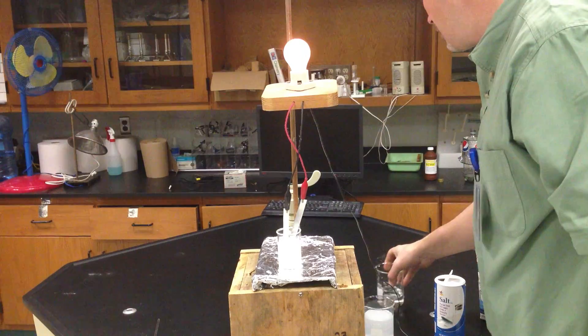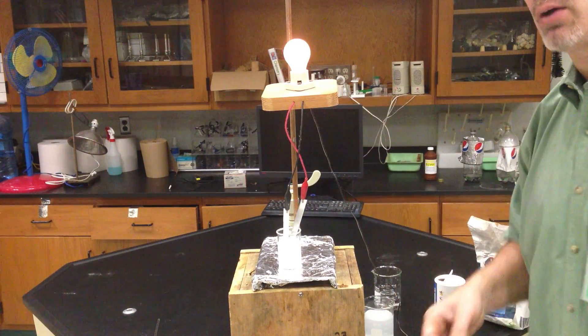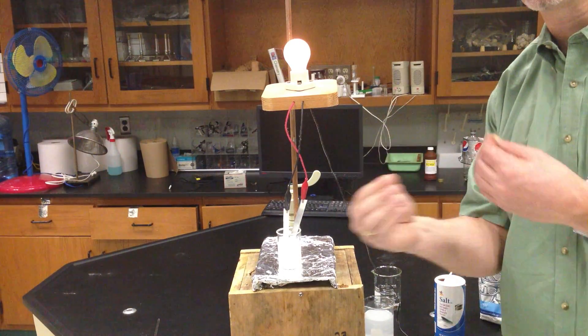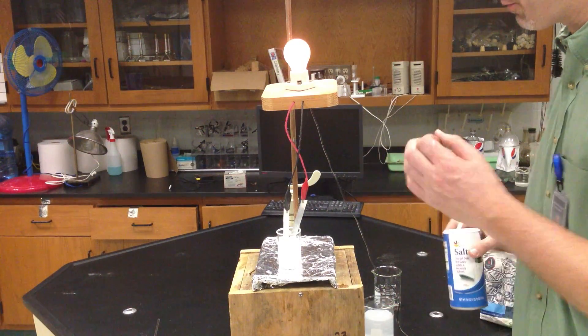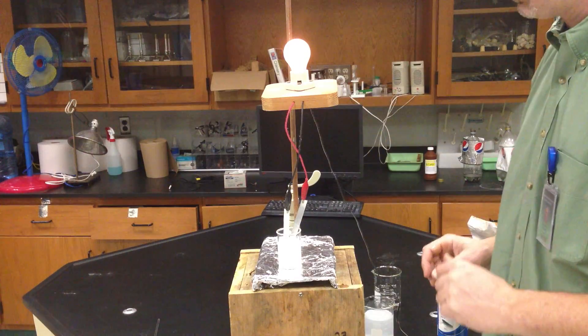So, a nice demonstration of how salts, ionic compounds, are electrolytes because their ions are free to move. They're not free to move when they're in the solid phase, but they're free to move when they're dissolved or when they're liquefied.